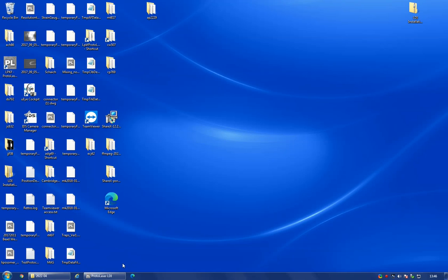So this is a tutorial about the software of the laser writer, which is called LPKF Protolaser LDI. You can find it either on the desktop here or in the taskbar at the bottom. So when you open it, you will see a screen like this.